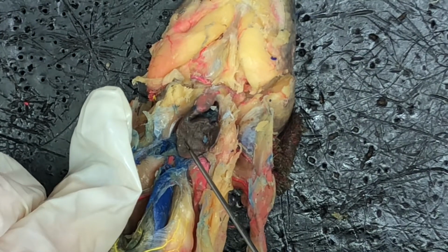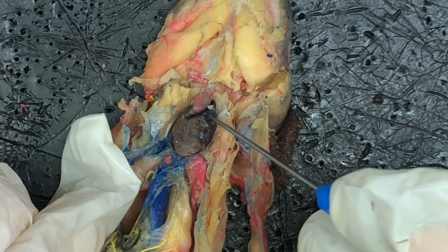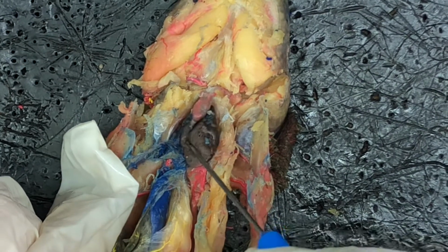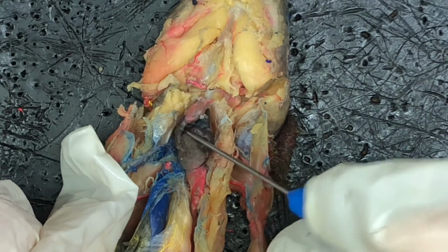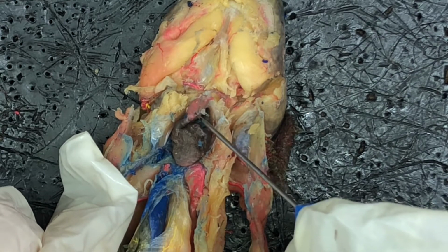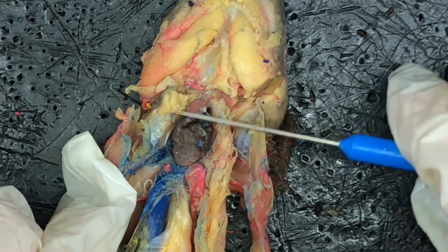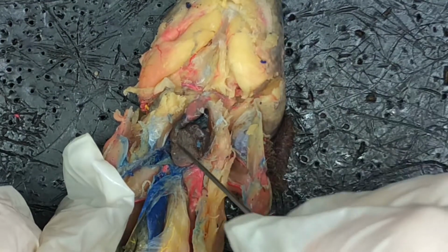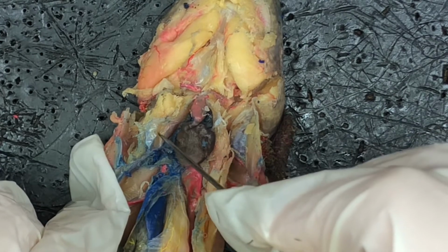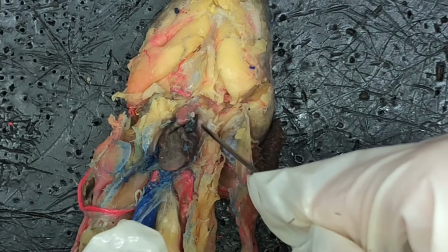This is the ventricle. We have the atria on the sides of the heart, so here and also on this side. The conus arteriosus is this little part right here, and then we have the bulbus arteriosus right here. The visceral pericardium would be on top of the heart, and then the parietal pericardium is the sac that it's in, which has mostly been torn away, but you can kind of see little parts left over of it on the side right here and right here.